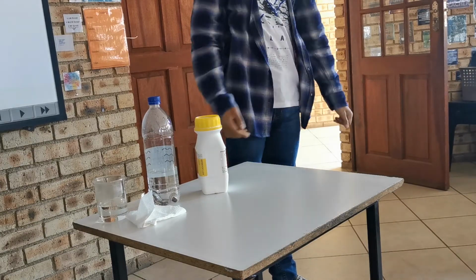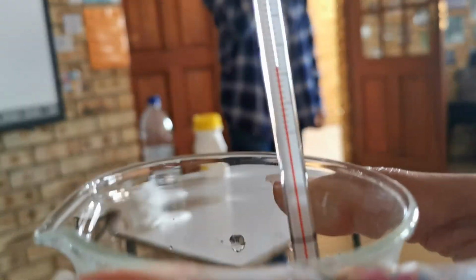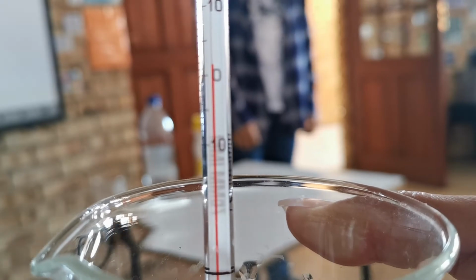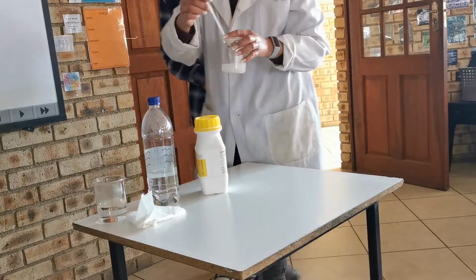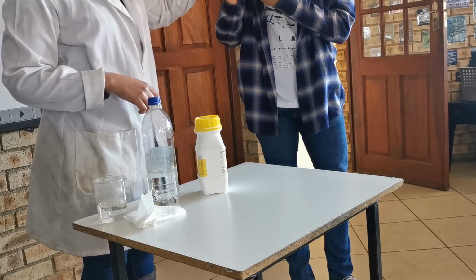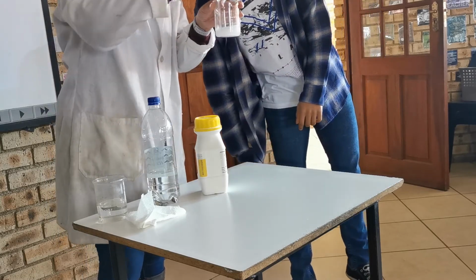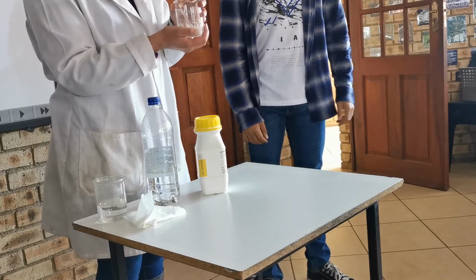So just to finish up, we've got it close to zero on the temperature scale, which means I've decreased the temperature by nearly 10 degrees. Nikolai, I need you to just touch the bottom and tell them how cold it is. It's not going to freeze. It's very close to zero. It stopped at about 2 degrees, which means I've got an 8 degree decrease in temperature.